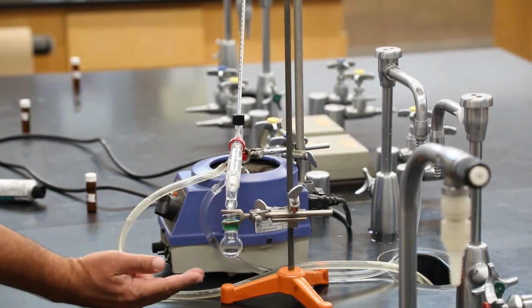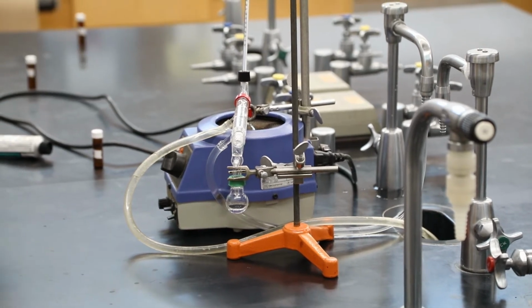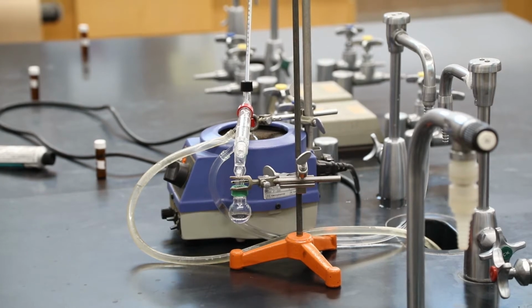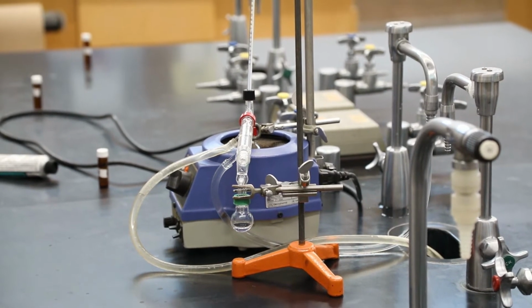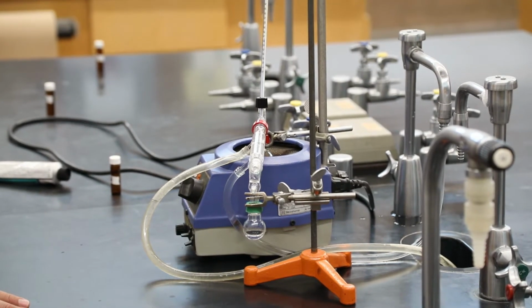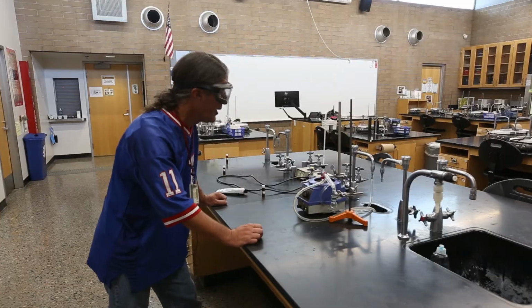And it looks like we've collected about 3 or 4 mils in here. We started with about 8 milliliters. It'd be nice if we could distill 6 in not too much time. We have 3 hours for the lab, and we're only doing 2 distillations, so we're way ahead of schedule because we've been careful and got everything set up efficiently, and everything went nice.